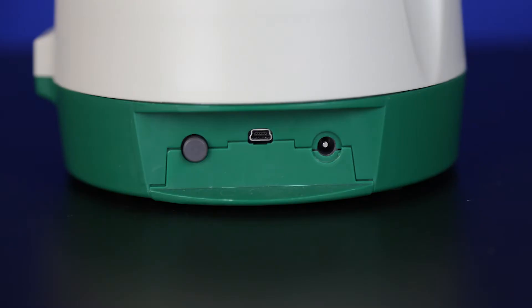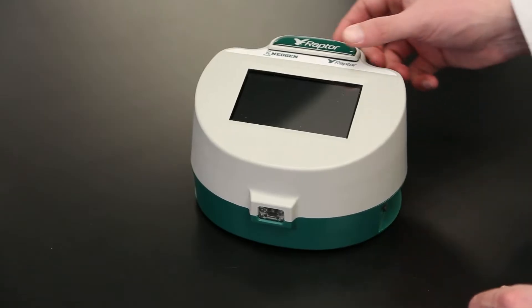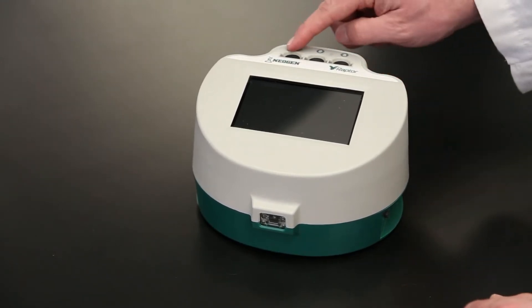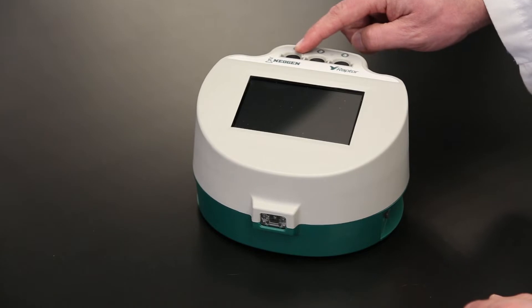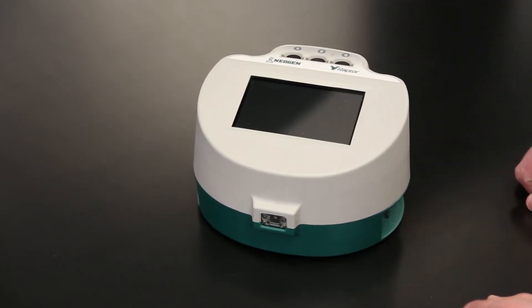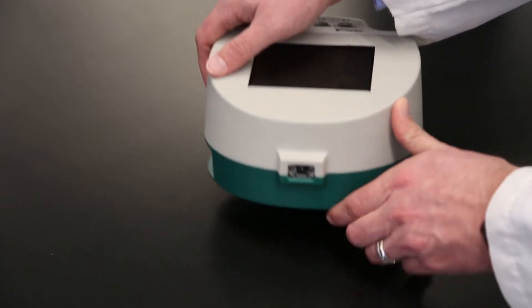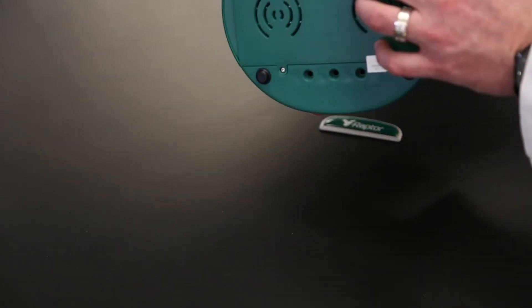The right side includes the power button, a mini USB port for data transfer to a computer, and the power input. On top, a magnetic cover protects the three sample ports when not in use. Each port can test a unique milk sample simultaneously and independently — it's like having three readers in one. Any milk accidentally spilled into the ports flows out through these three holes without damaging the Raptor.